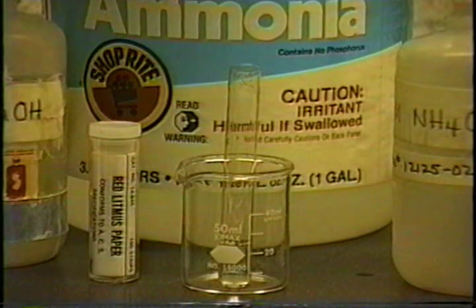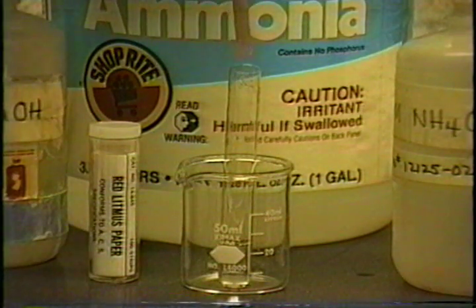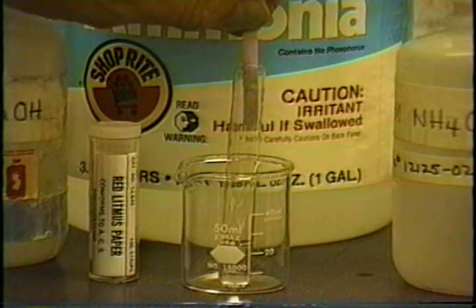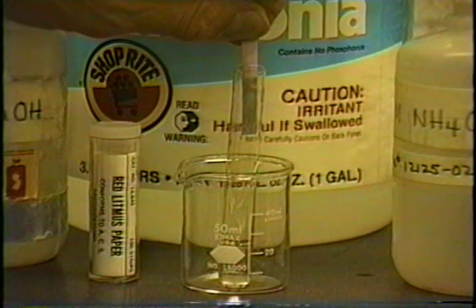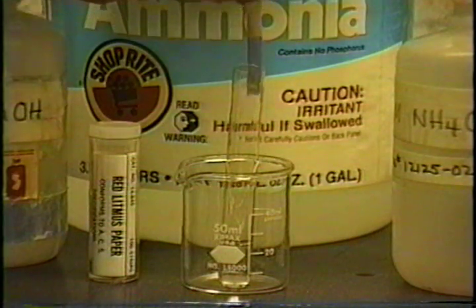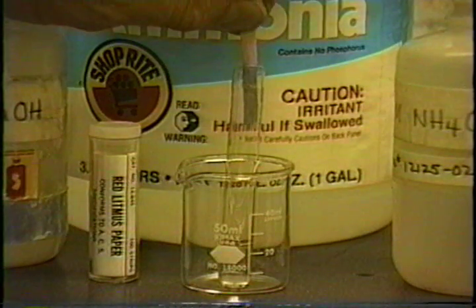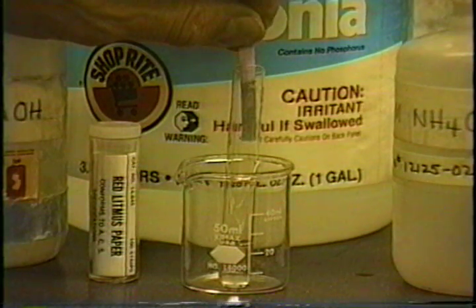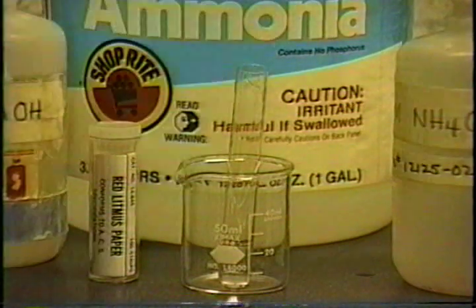All right, here's the test for ammonia. Now what we do is we have moistened a little piece of pink litmus paper and we put it inside the test tube so it doesn't touch the side. And you can see that it is evenly turning blue. Where it does touch the side, since there is sodium hydroxide in it, it will turn blue anyhow. But the fact that the middle, which is not in contact with any possible sodium hydroxide, is turning blue, means that you have a vapor there, which is basic, which probably means that you have ammonia.